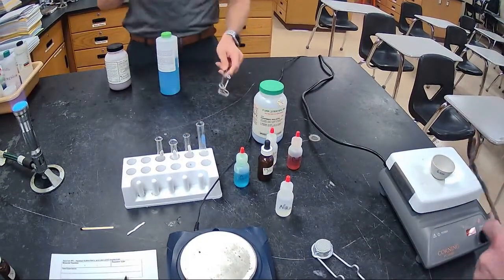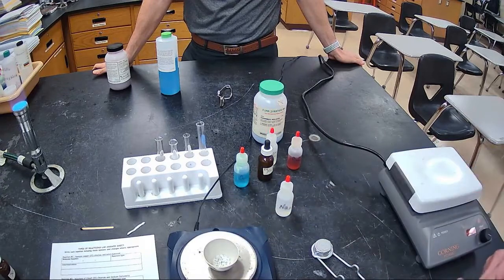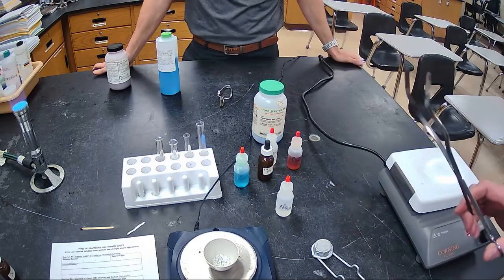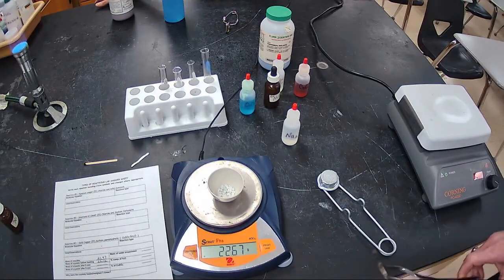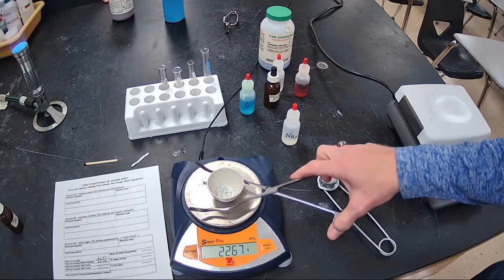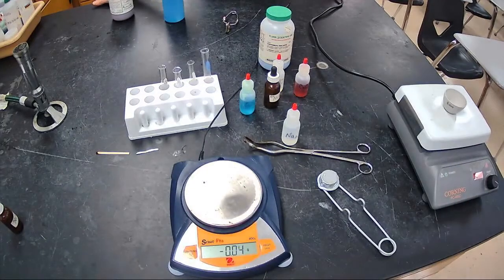We'll get our mass of our crucible back here, and we'll find its mass. So now we're at 22.68, 7. I think we need to adjust our camera so we can see it. There we go. Okay, so we're at 22.67. That's kind of where it settled. 22.67. I'm going to heat it for another 3 minutes and see where it is at that point. And then we can continue.